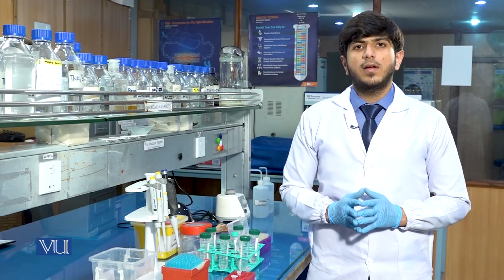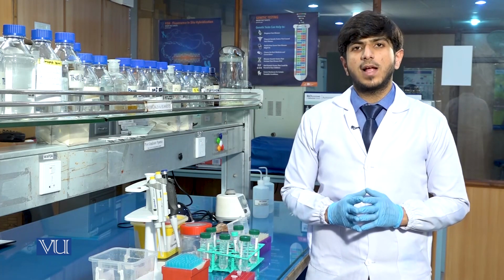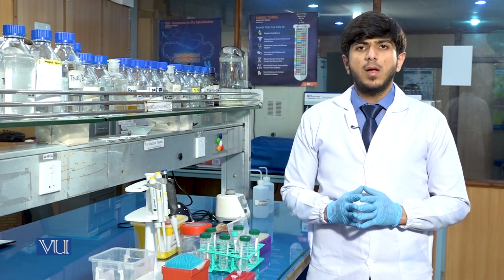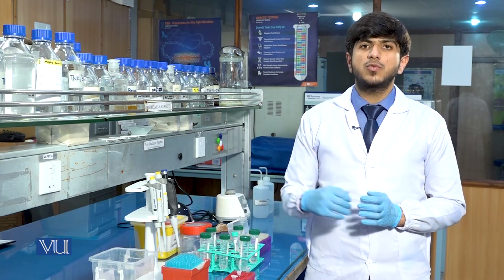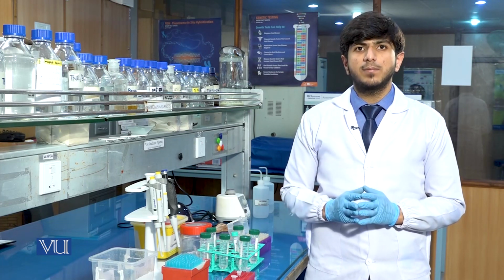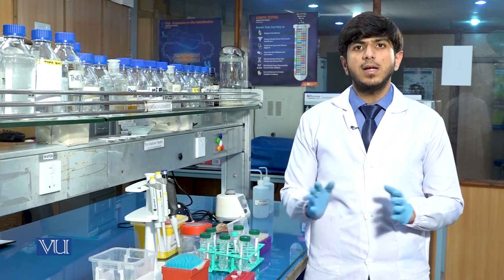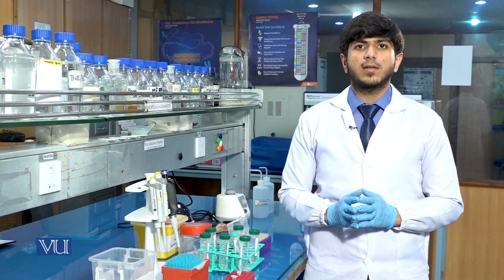After the addition of proteinase K, we will add the 80 microliter of sodium dodecyl sulfate, which is commonly known as SDS. The basic function of SDS is also to denature the proteins. Basically, SDS is a detergent that imparts negative charge to all proteins. And we know that DNA also contains the negative charge. So when all the proteins get the negative charge, they will get repelled from the DNA and will be separated from the DNA. So SDS is also used to digest the protein.